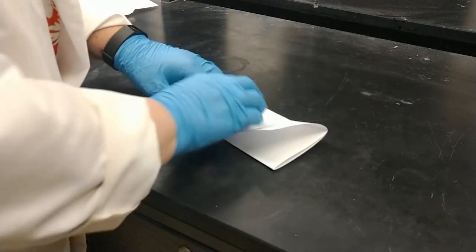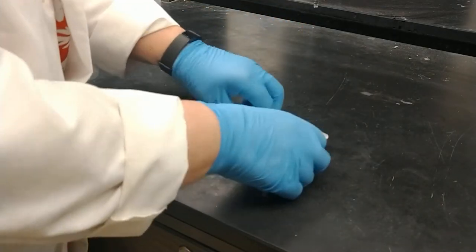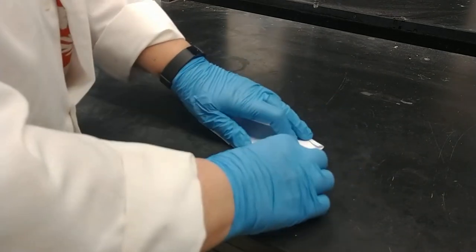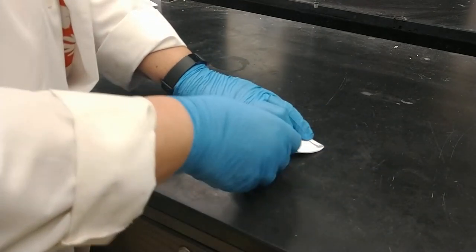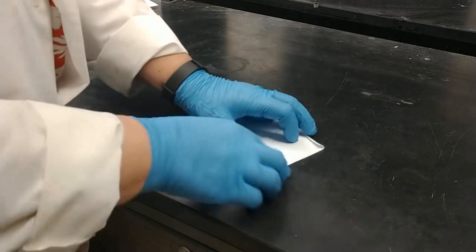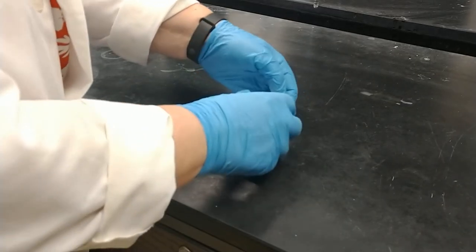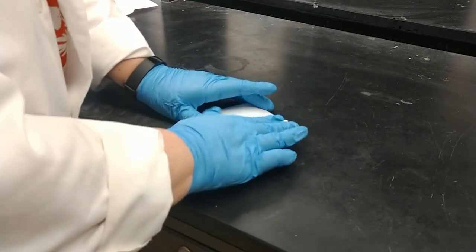So now I'm folding it, folding it, folding it. And then I'm going to tuck this in. A lot of people like to fold those in a little bit so it's easier to fold into this tuck here.